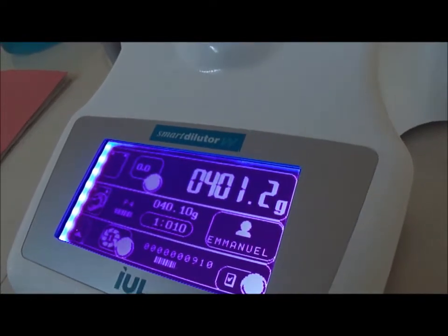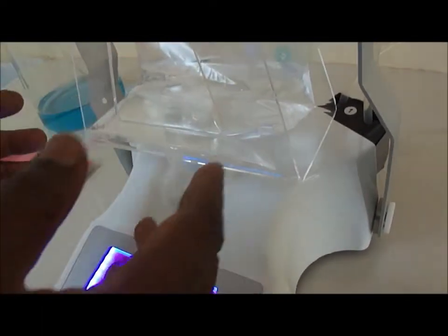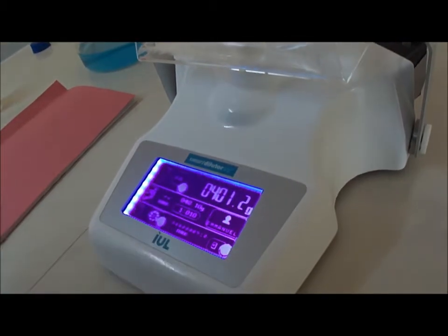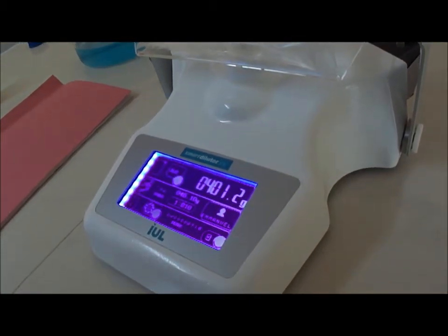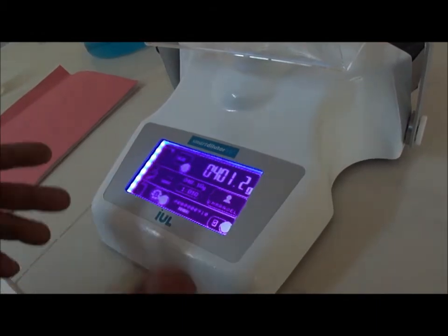Then, you get this beep, showing that you have made your dilution, according to the factor 1 out of 10. And that's all, for dilution. The next, we will show how the dispensing is done.